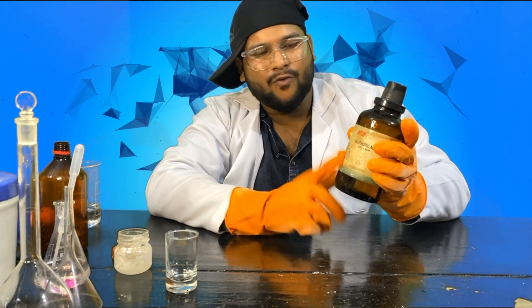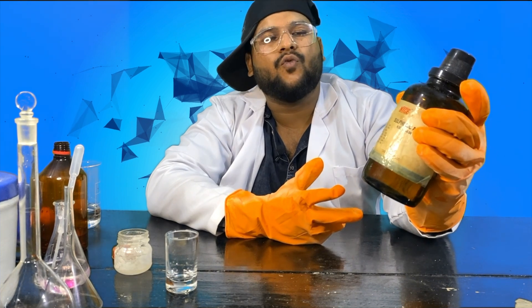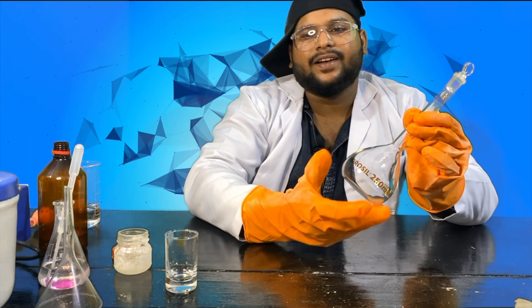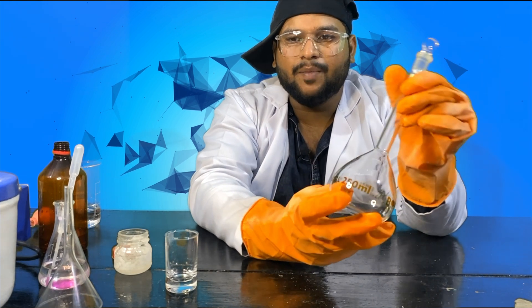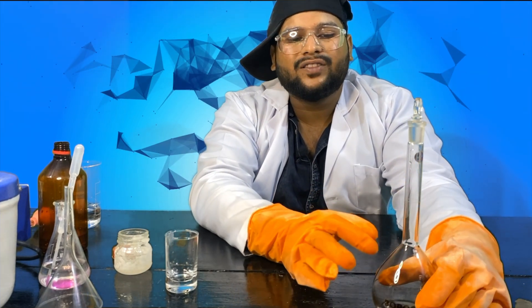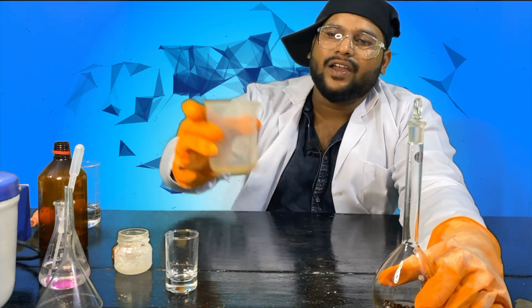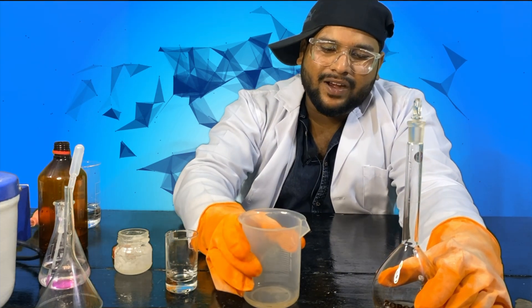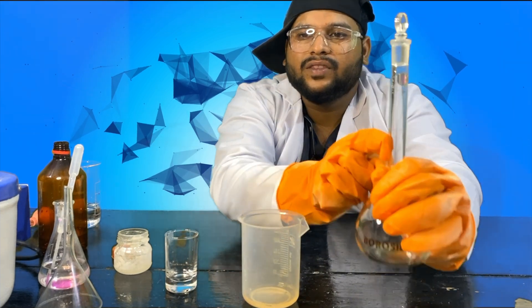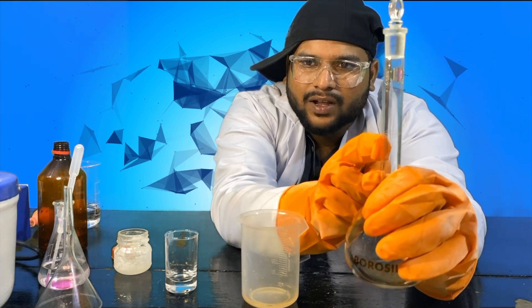We have now calculated that we need 1.33 ml of sulfuric acid to make a 0.1 molar dilute solution. This is our 250 ml volumetric flask, and we are going to add 1.33 ml of concentrated sulfuric acid into it and dilute up to the marked volume.